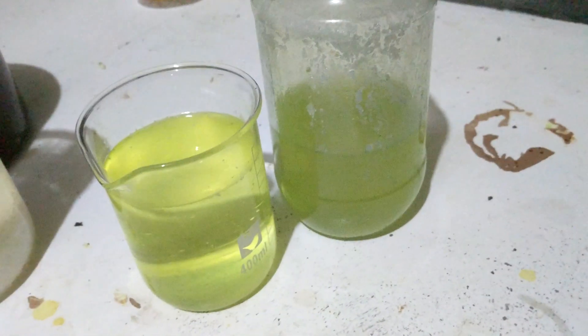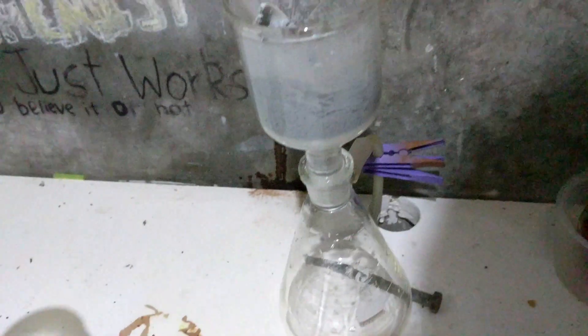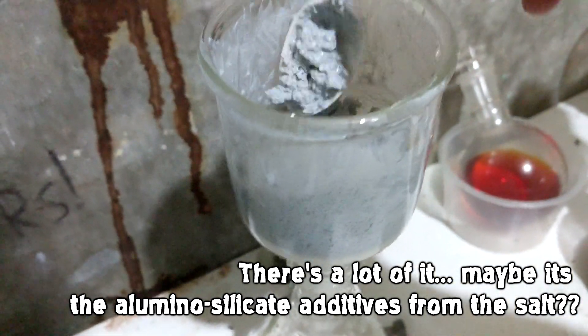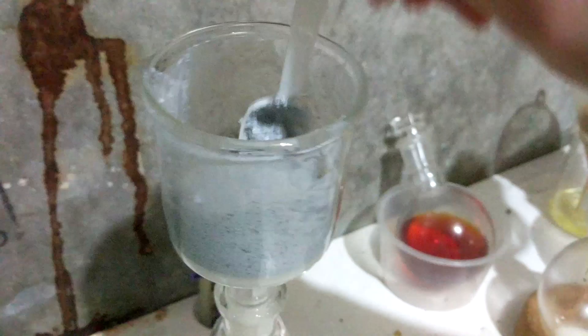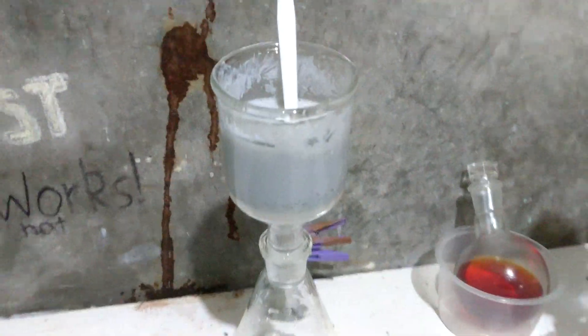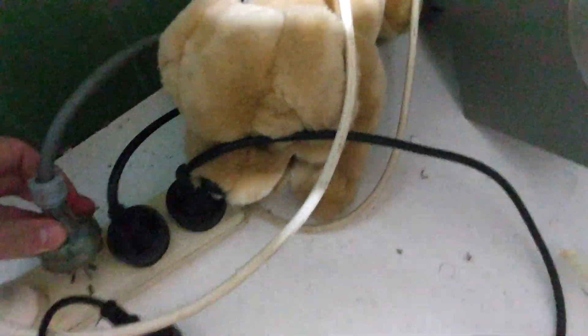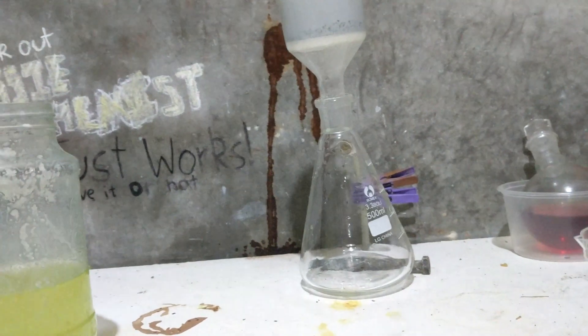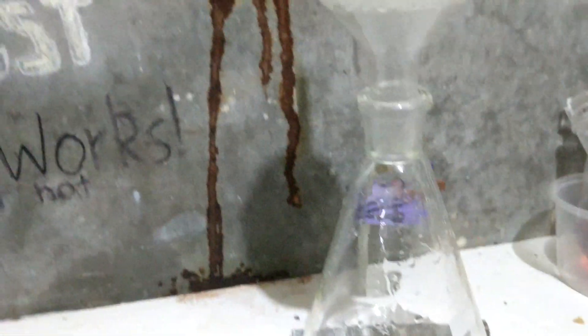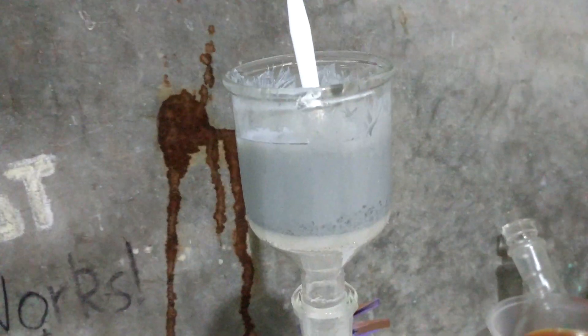Here's all our filtered solution. You remember me saying the crystals were looking slightly grey? Well, they're very grey. There's quite a lot of what appears to be metal — just judging by the colour. There's a lot of really nice crystals in there, but there's also a lot of grey crap. I'm assuming the grey crap is insoluble, so I'm going to get some distilled water, dissolve everything soluble — which should predominantly just be chlorate — and run it through into this clean flask down here. The metal powder, titanium dioxide or whatever is in there, is really good at clogging this filter.